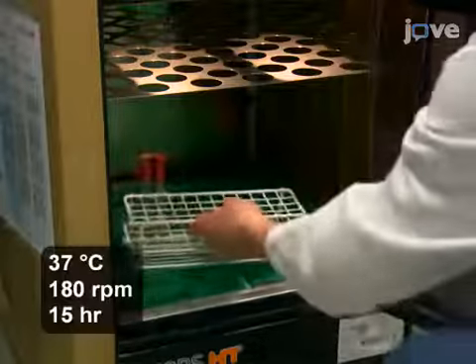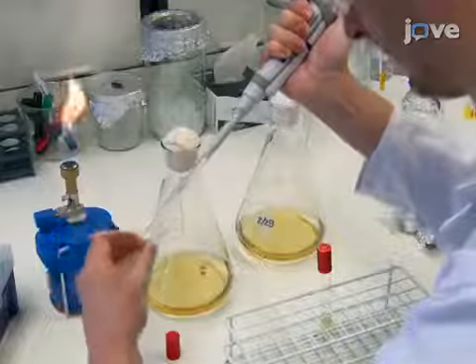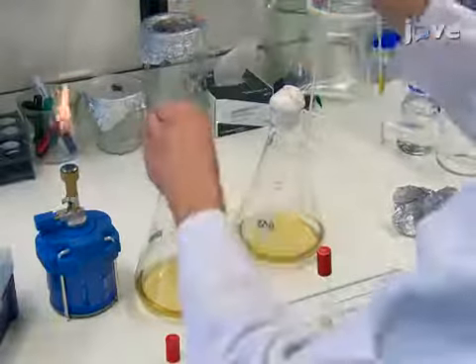Incubate the pre-cultures in a shaker for 15 hours. Dilute 2 milliliters of the culture into 200 milliliters of LB with ampicillin in 2 1-liter flasks.